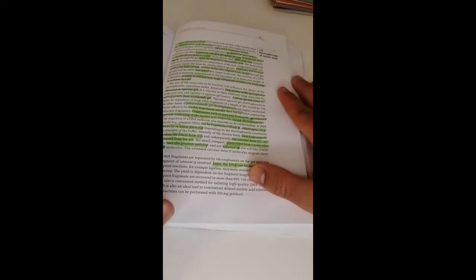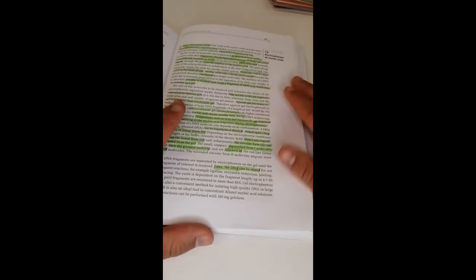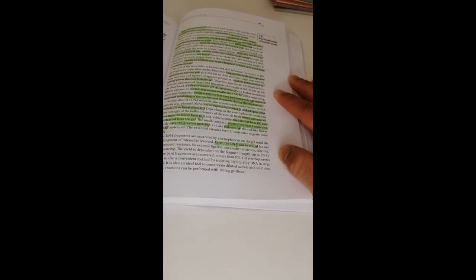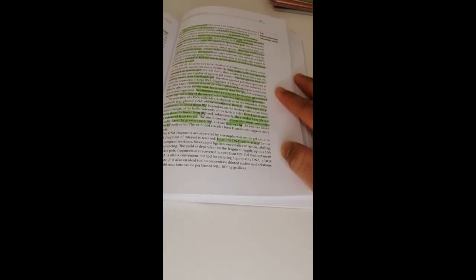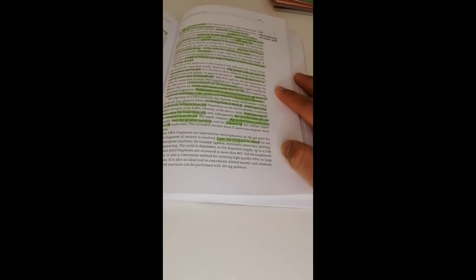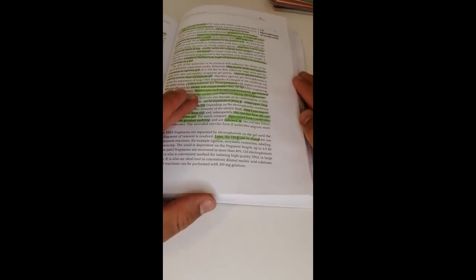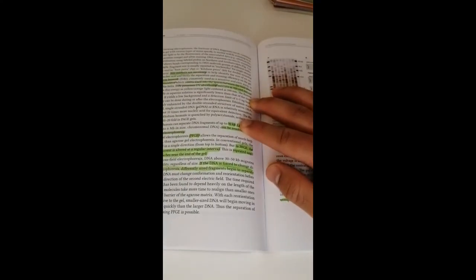After the DNA has been separated, you can elute the DNA from the gel for further analysis. DNA can be analyzed using enzymatic restriction — restriction enzymes — sequencing, and also labeling with fluorescent labels or antibodies, or even blotting. It can be used in combination with a lot of techniques to label certain protein sequences that are present or absent in other patterns. That's also how we carry out paternity tests.